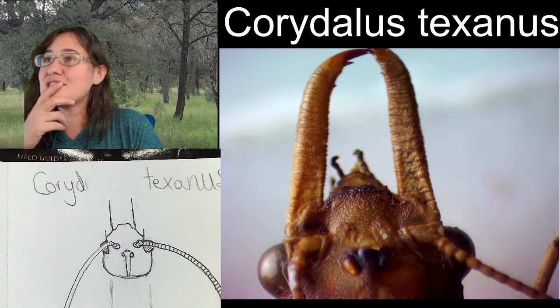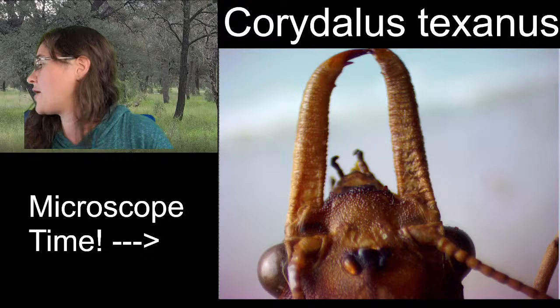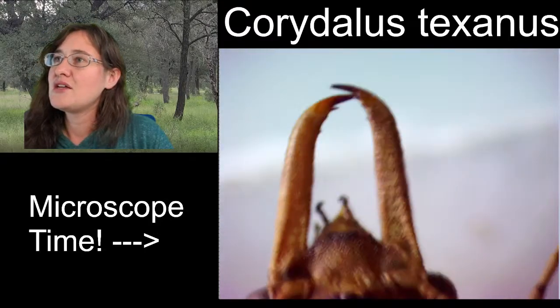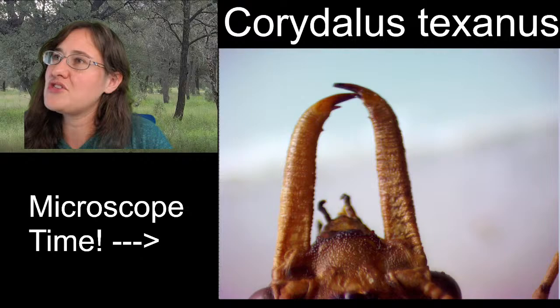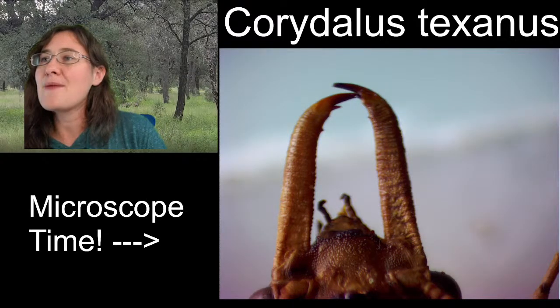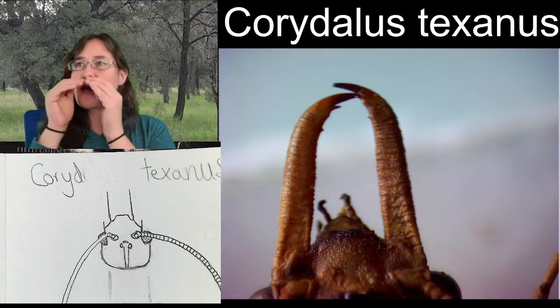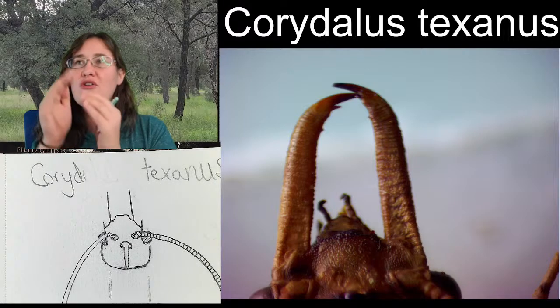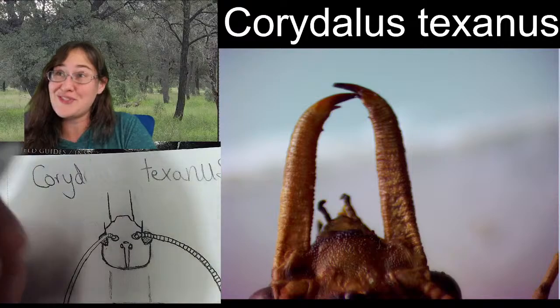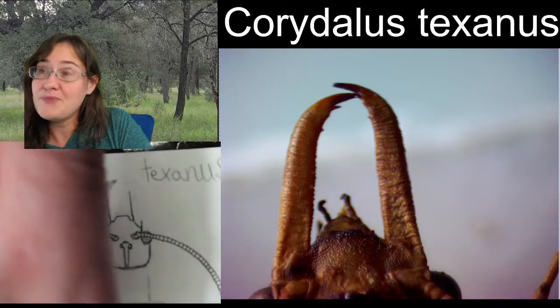And if we wanted to draw it hyper-realistic with this specimen, it looks like the right mandible is just a little bit in front of the left one. I'm not sure if this specimen ever met in the middle or if they've always been a little off-center, so I'm going to be sketching them a little bit off-center. So let's see.